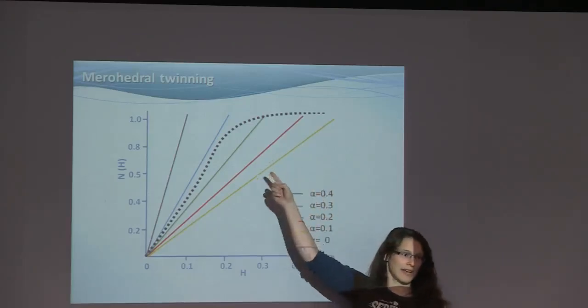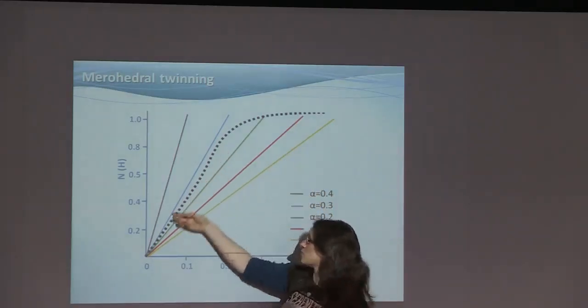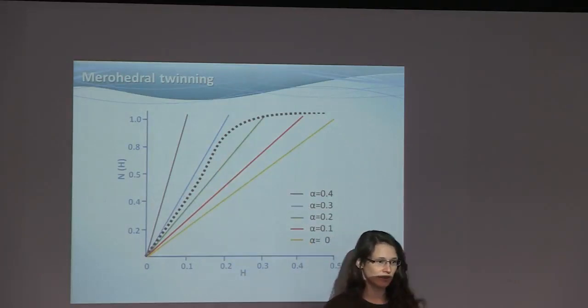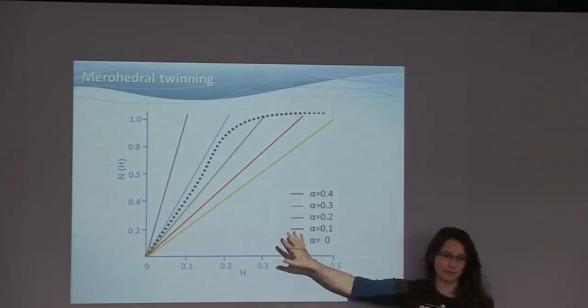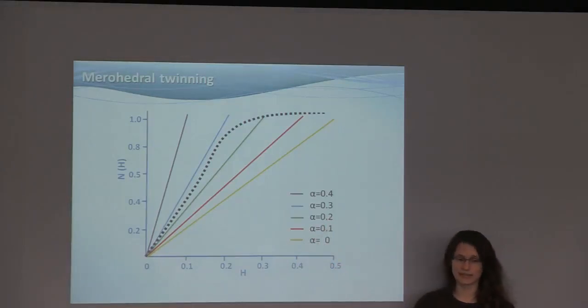There's the slope, and that's often a thing, and you can ignore that. So actually where most of the graph is sitting is interesting. But you can also see that the determination of alpha is not very exact. So if you have a merohedral twin and you've done the H test and you are putting this in your paper, you should not give the twin fraction to the third digit because it's a statistically derived, not so certain thing. Possibly giving it to the first or second digit is good.